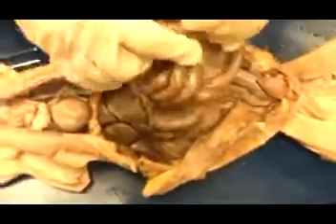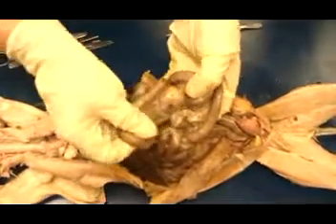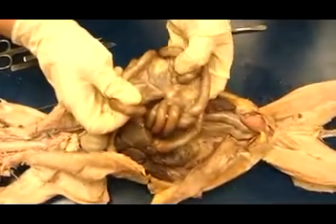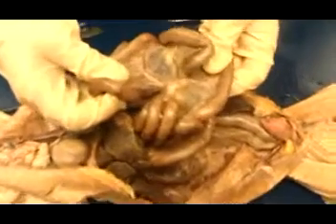Right here along the curvature of the stomach and the curvature of the duodenum, we have this glandular organ. This is the pancreas. The small intestine itself has this extensive mesentery, which looks like saran wrap and has blood vessels in it. As the blood vessels absorb the nutrients, there are also lymphatic vessels here. They carry and transport those nutrients to the liver and then to the remaining part of the circulatory system.